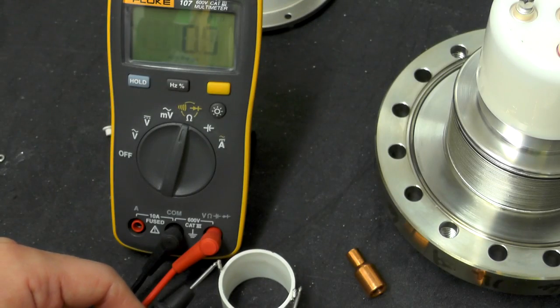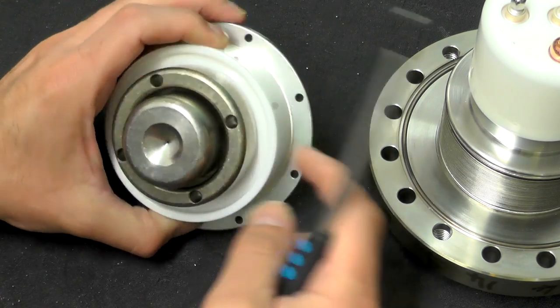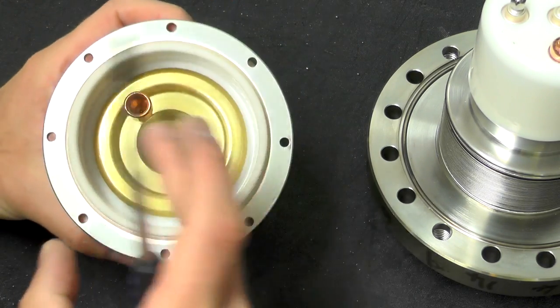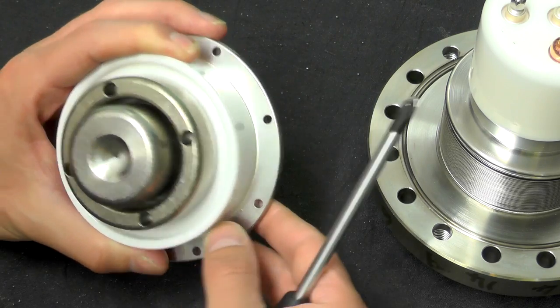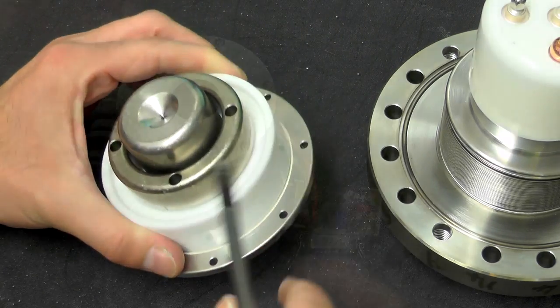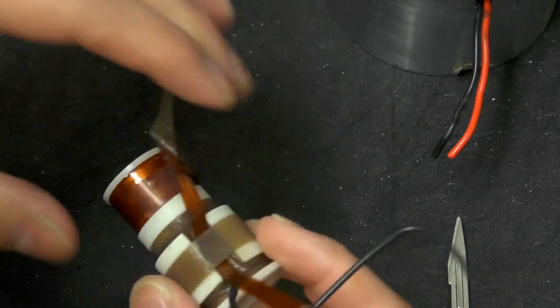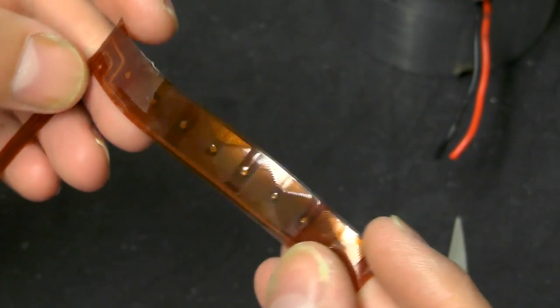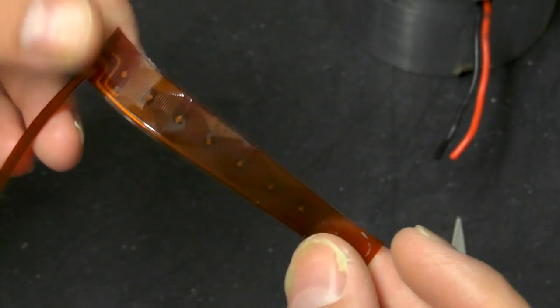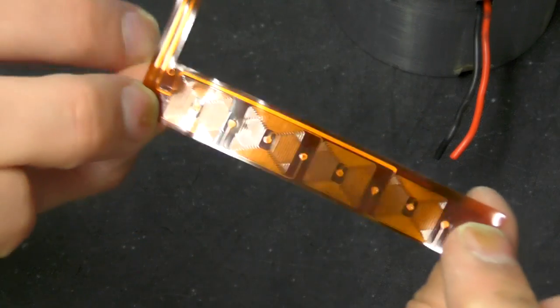This outer metal ring seems to just be securing the metal piece in place, though maybe it serves some other purpose as well. Looking at the coil assemblies, I'm guessing this must be the stigmatism control. We have a total of eight coils on a flat flex.